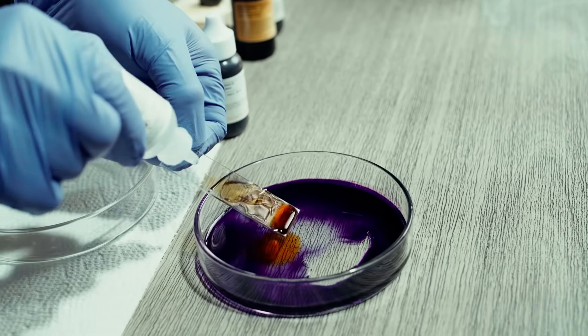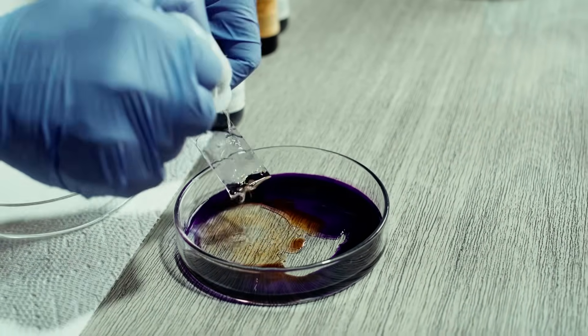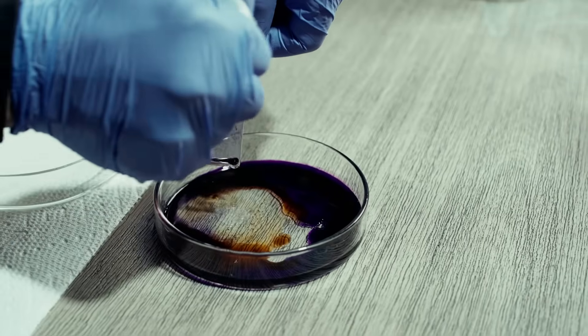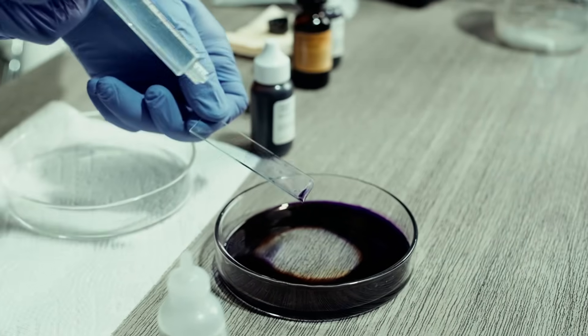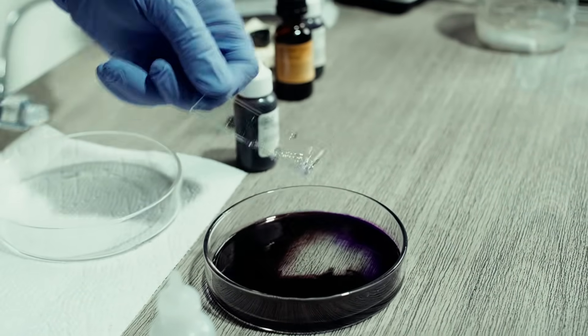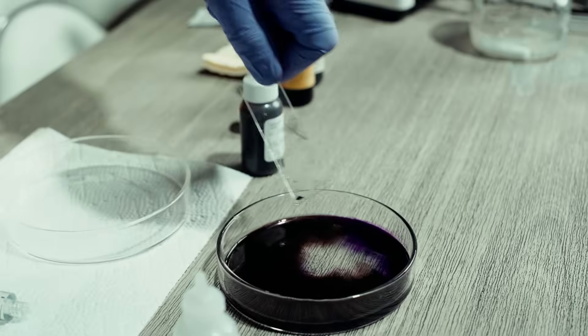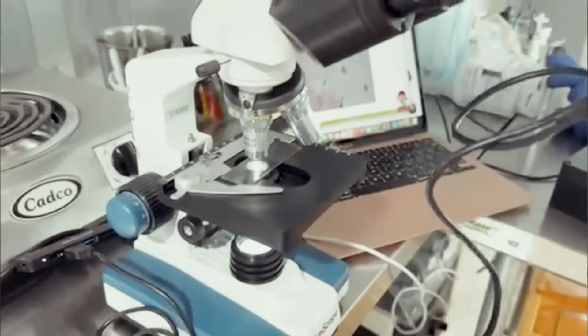Then we're going to take our decolorizer, which is going to wash off any excess gram positive stain that would be remaining. Then we're going to rinse and dilute it with water so that when we add our counter stain, it will be absorbed by any potentially gram negative organisms. I don't know what's going to appear on our sample, but hopefully we find something.